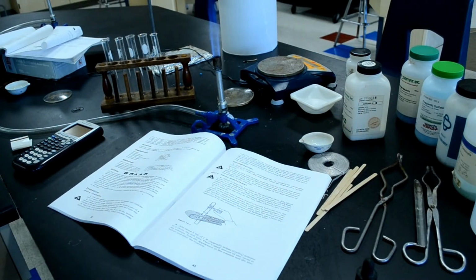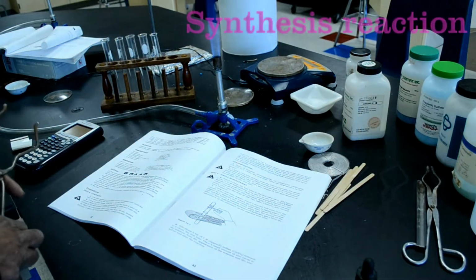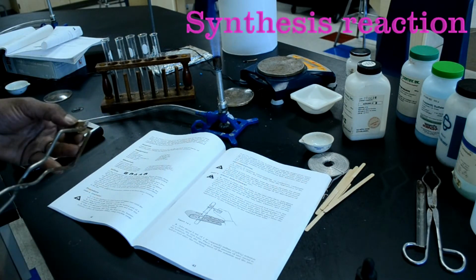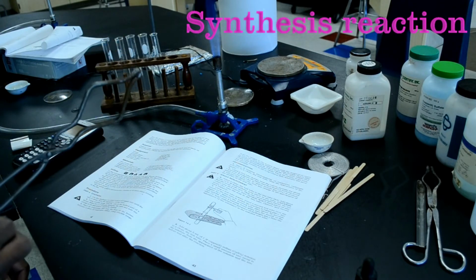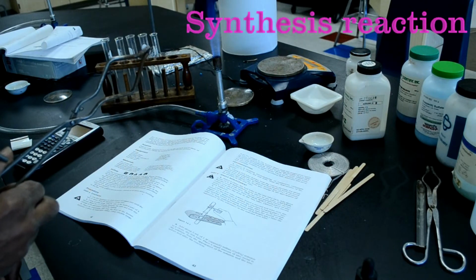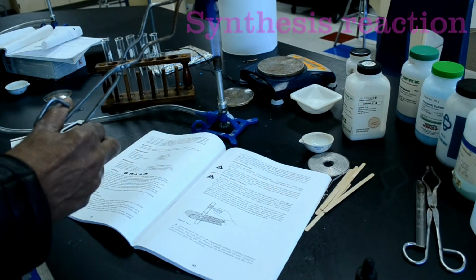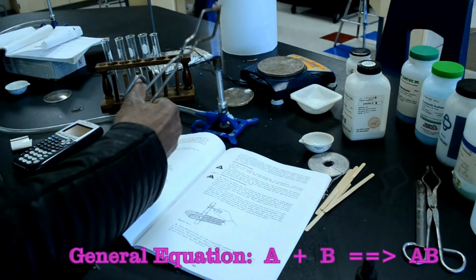Okay, the procedure. Use fine sandpaper to clean a piece of copper wire until it's shiny. Note the appearance of the wire. We're going to use a piece of copper metal here that is actually a reddish brown color. And using crucible tongs, place the wire in the hottest part of the burner flame for 1 to 2 minutes. Examine the wire and note any change in appearance caused by heating.